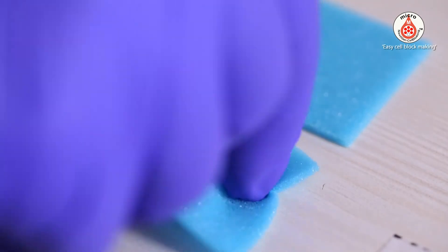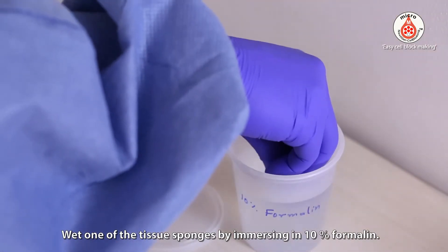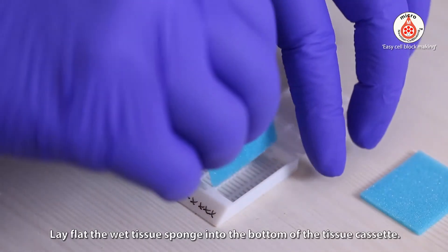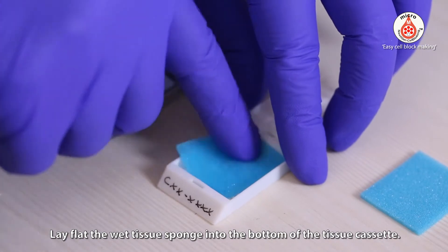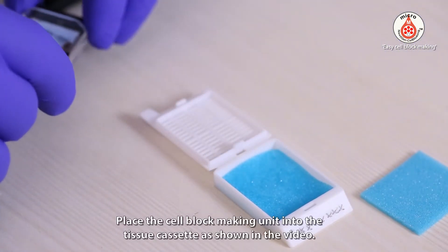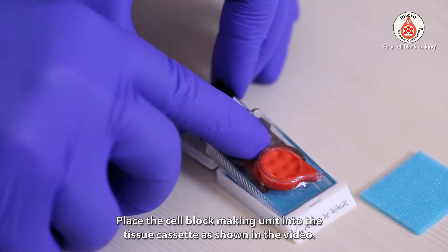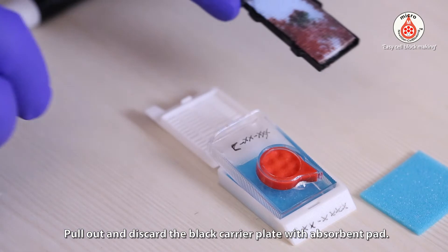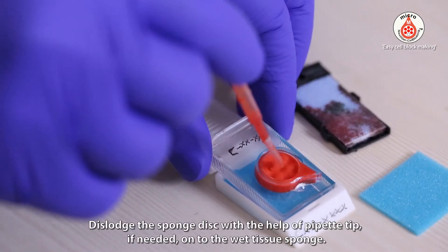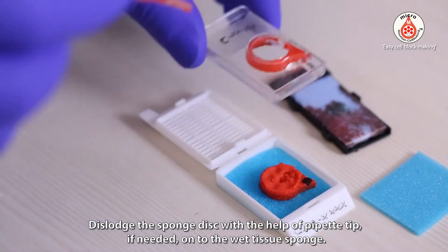Label the tissue cassette. Wet one of the tissue sponges by immersing it in 10% formalin, then lay the wet tissue sponge flat into the bottom of the tissue cassette. Place the cell block making unit into the tissue cassette as shown in the video. Pull out and discard the black carrier plate with the absorbent pad. Dislodge the sponge disc with the help of a pipette tip if needed, onto the wet tissue sponge.